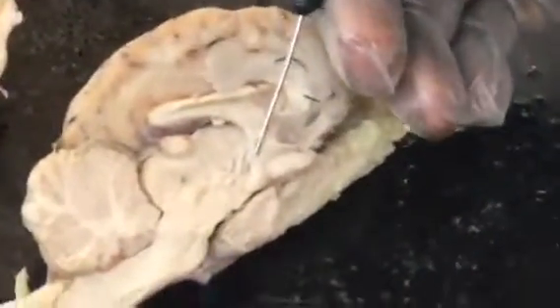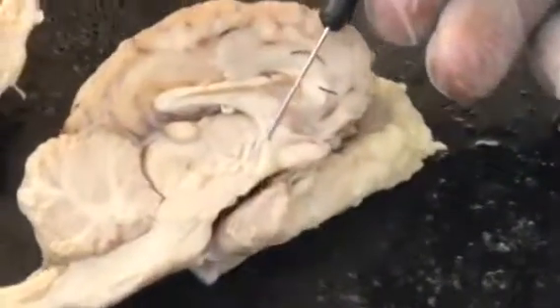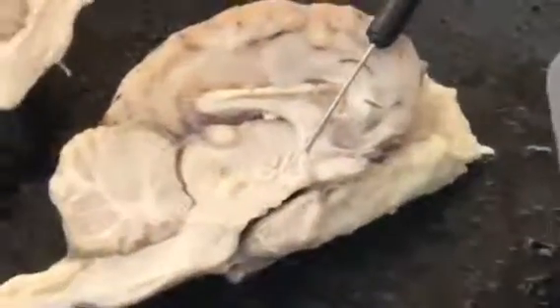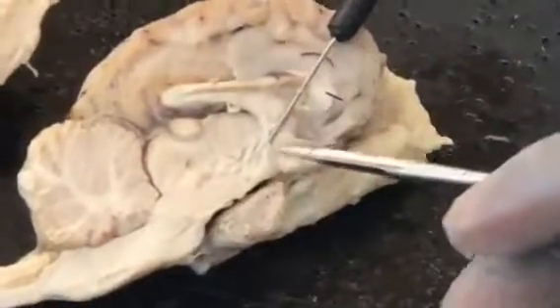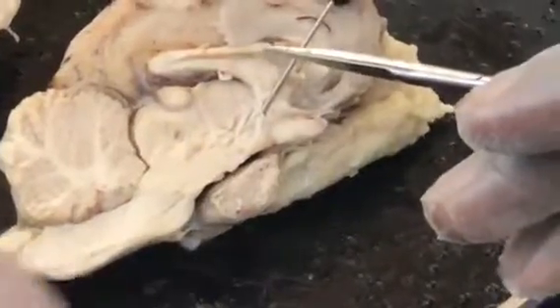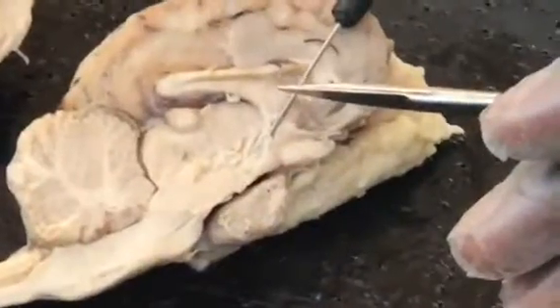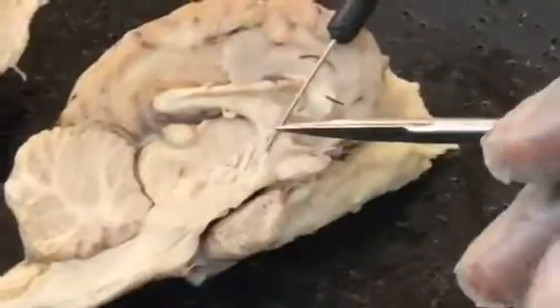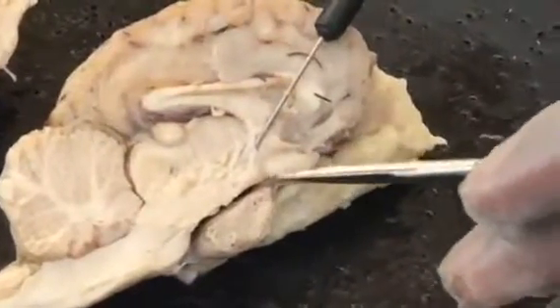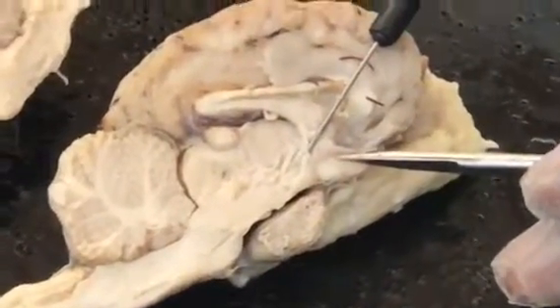See if I could actually get into the space and through it. So where the tip of this thing is here, this is your third ventricle, which makes sense because for your cerebrospinal fluid, it goes from the lateral ventricle to your interventricular foramen to your third ventricle to your cerebral aqueduct to your fourth ventricle. So this is your third ventricle, and below your third ventricle is your optic chiasm, which is cool because you actually have two divisions of it, which you can see, which come up very well.